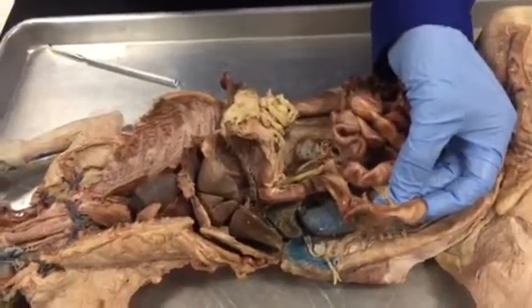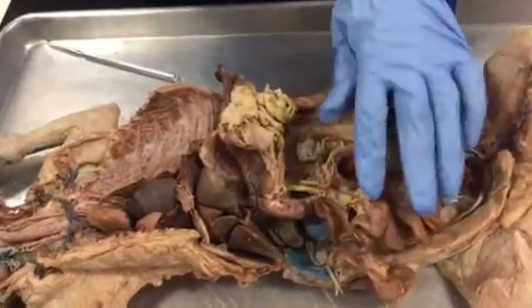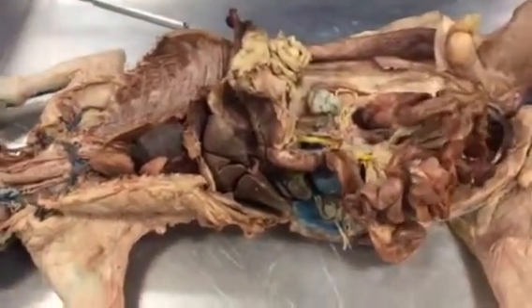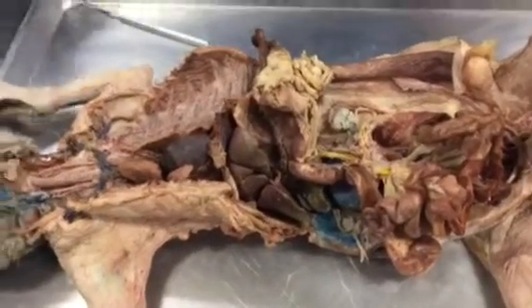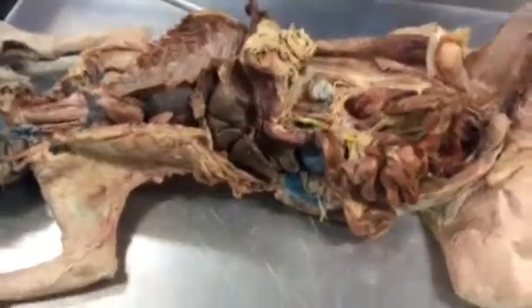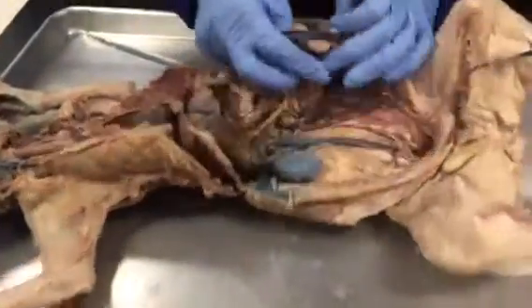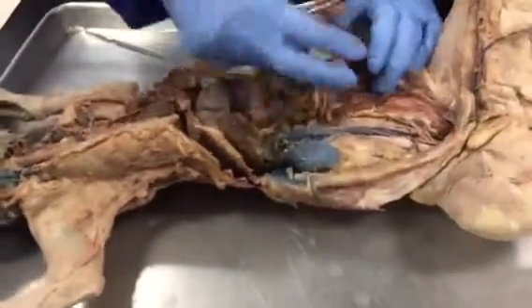Okay. So the models. So these are the only things you need to know in the cats. And then reproductive organs. So for reproductive organs, if it's a female, you need to know the ovary, fallopian tube, body of the uterus, and uterine horns. So this cat is the female. So I will show you here.